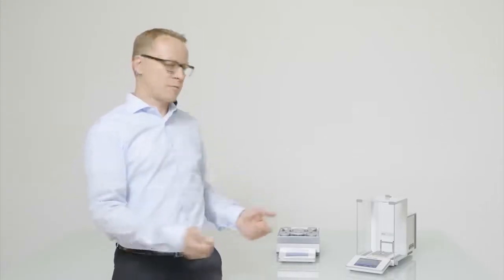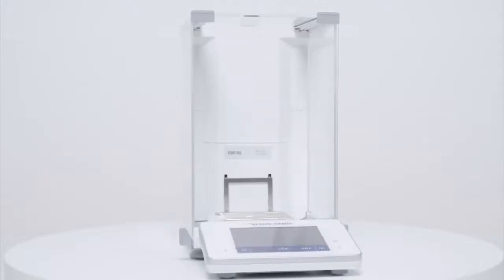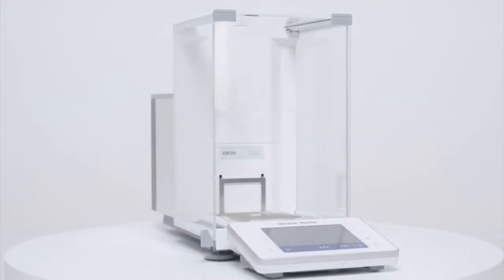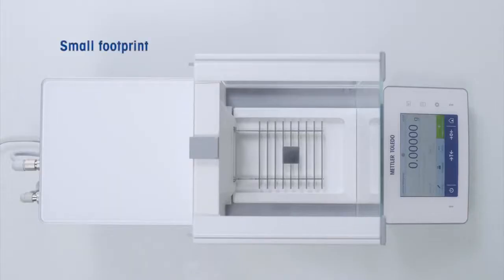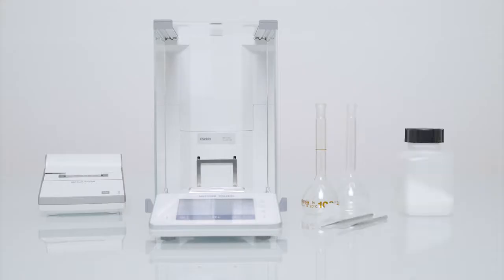So let's get started on the instrument. XSR balances come with a small footprint. It minimizes occupied space and maximizes space for other equipment such as substance containers, spatulas or tare vessels. Today we want to demonstrate how efficient and reliable weighing is on an XSR balance.